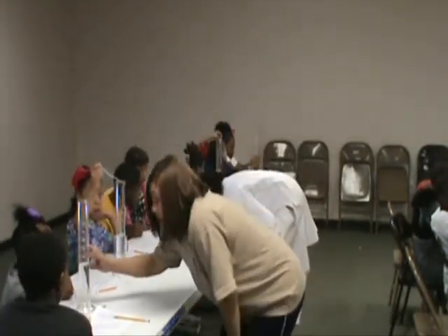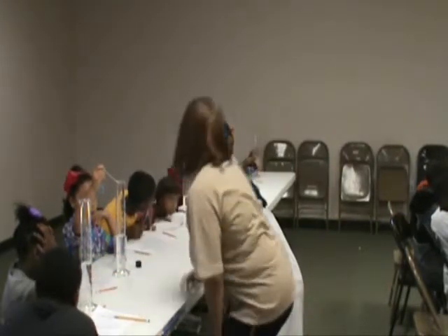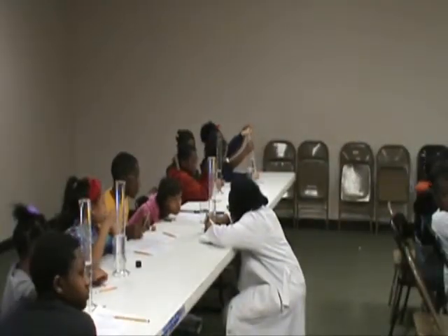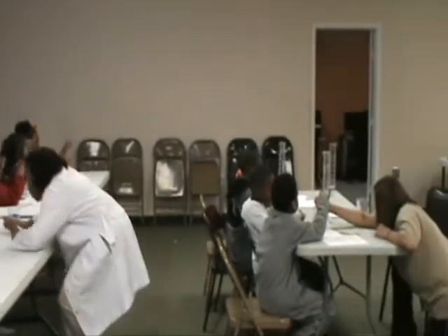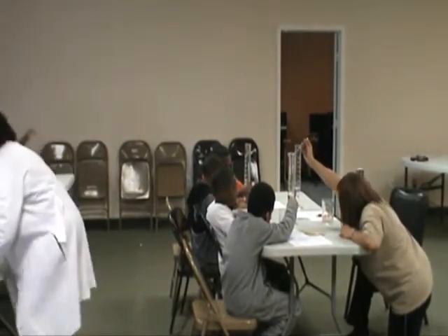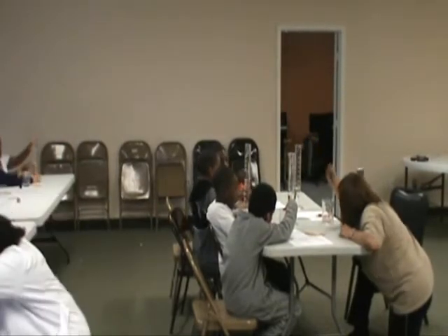How's yours look? Are y'all ready? Is it perfect? Oh my, that one is perfect. Stay right there. That was perfect. Let me see this meniscus. Oh, this is the perfect one from the very beginning, right? I want to see that mirror. That was a good one. Okay, you see that? Now go down low.